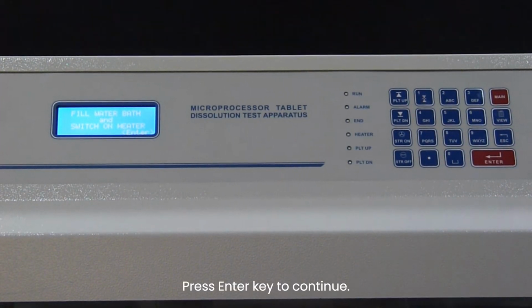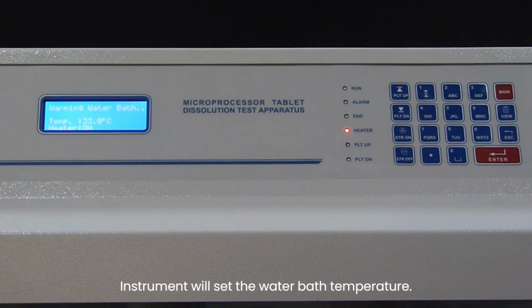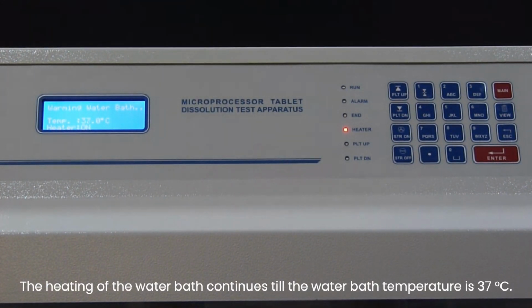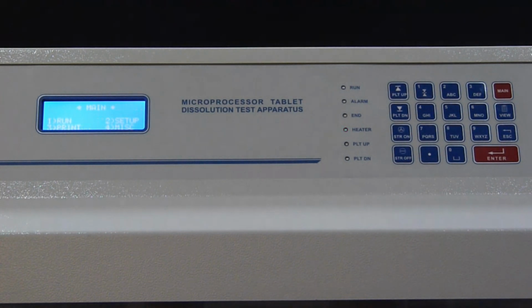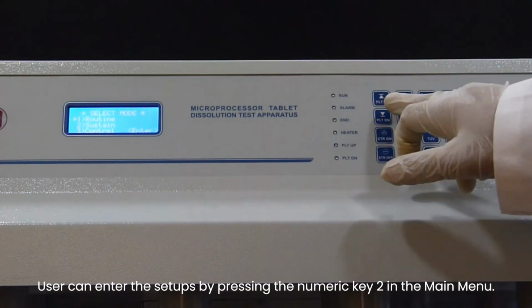Press Enter key to continue. Instrument will set the water bath temperature. The heating of the water bath continues till the water bath temperature is 37 degrees Celsius. Once it reaches that temperature, the main menu is displayed. User can enter the setups by pressing the numeric key 2 in the main menu.